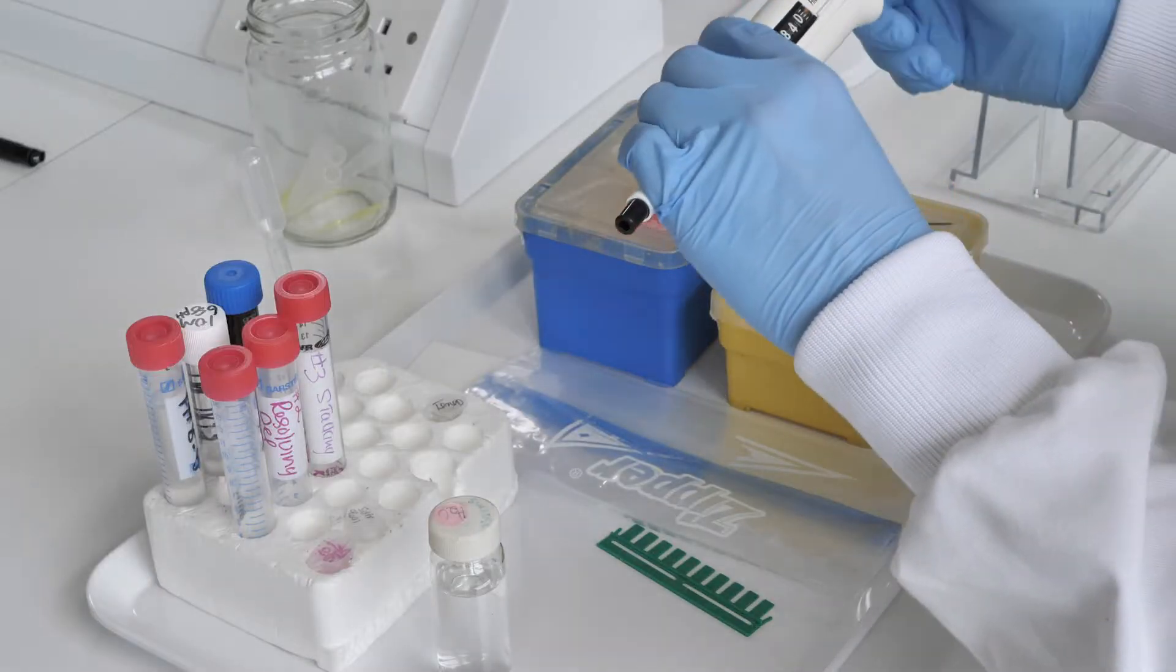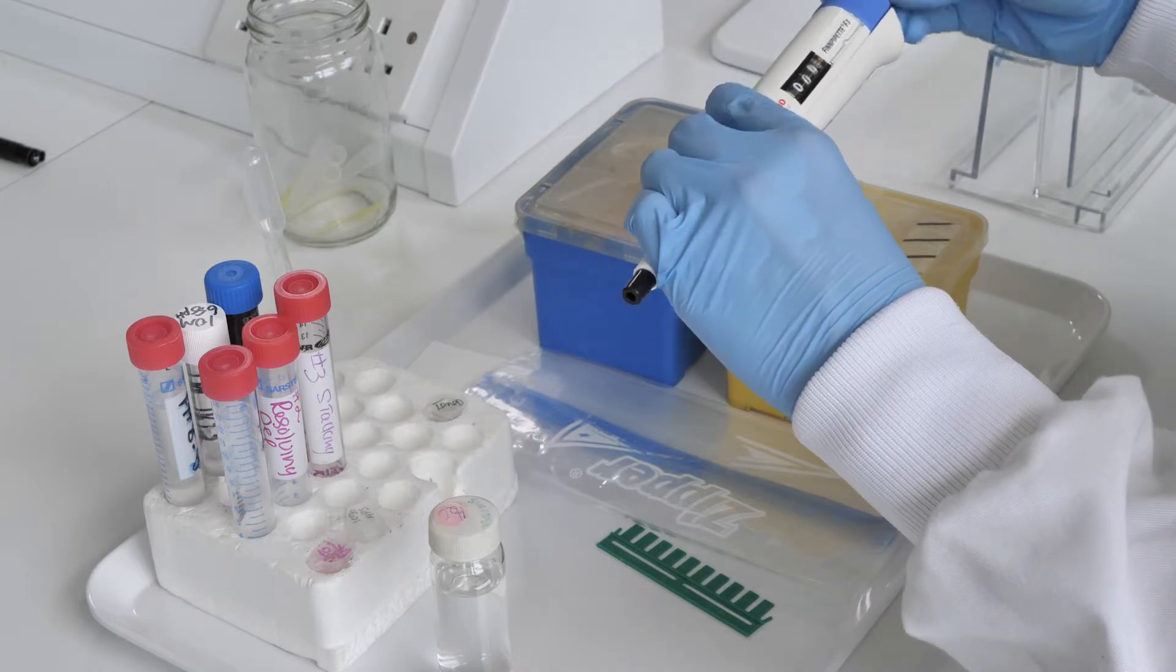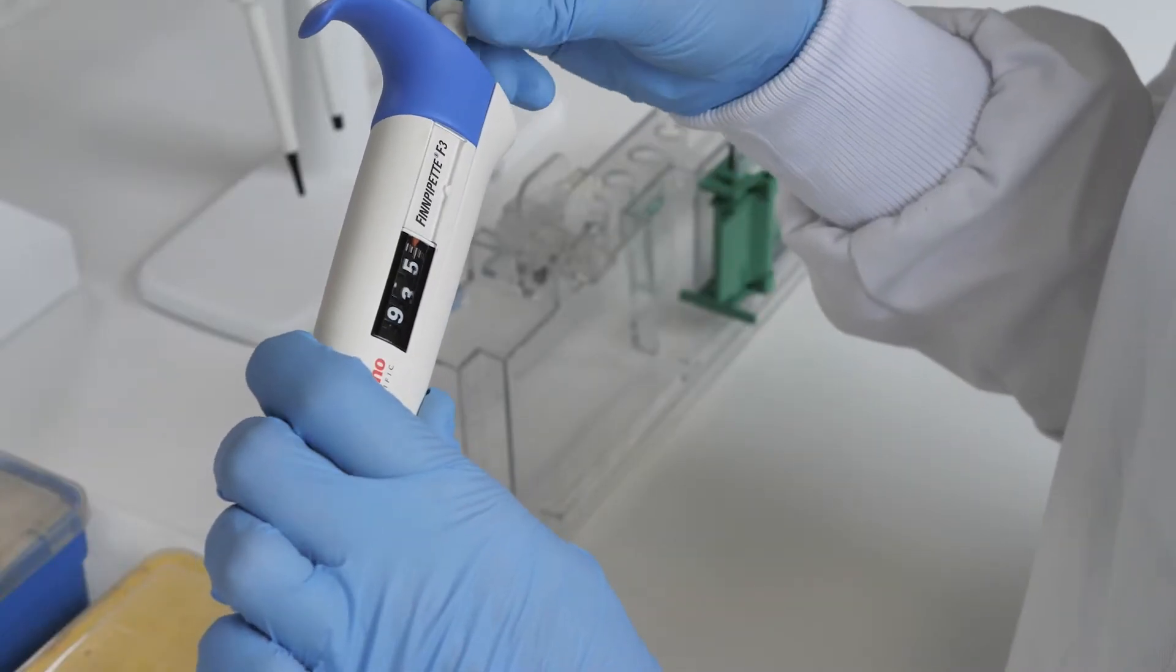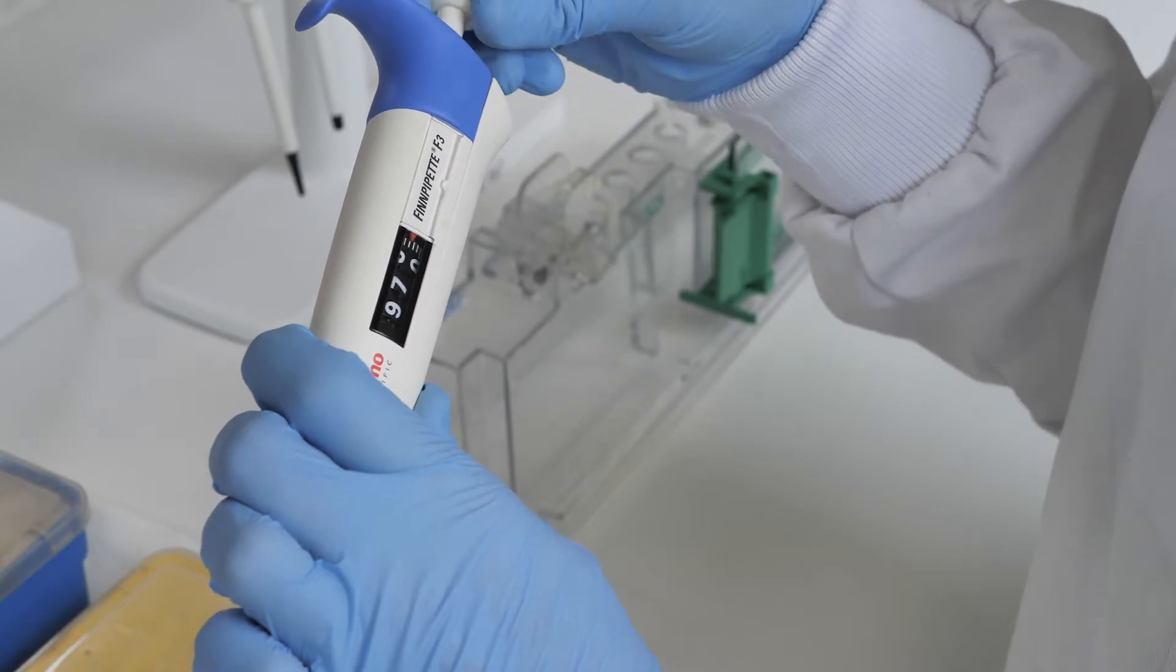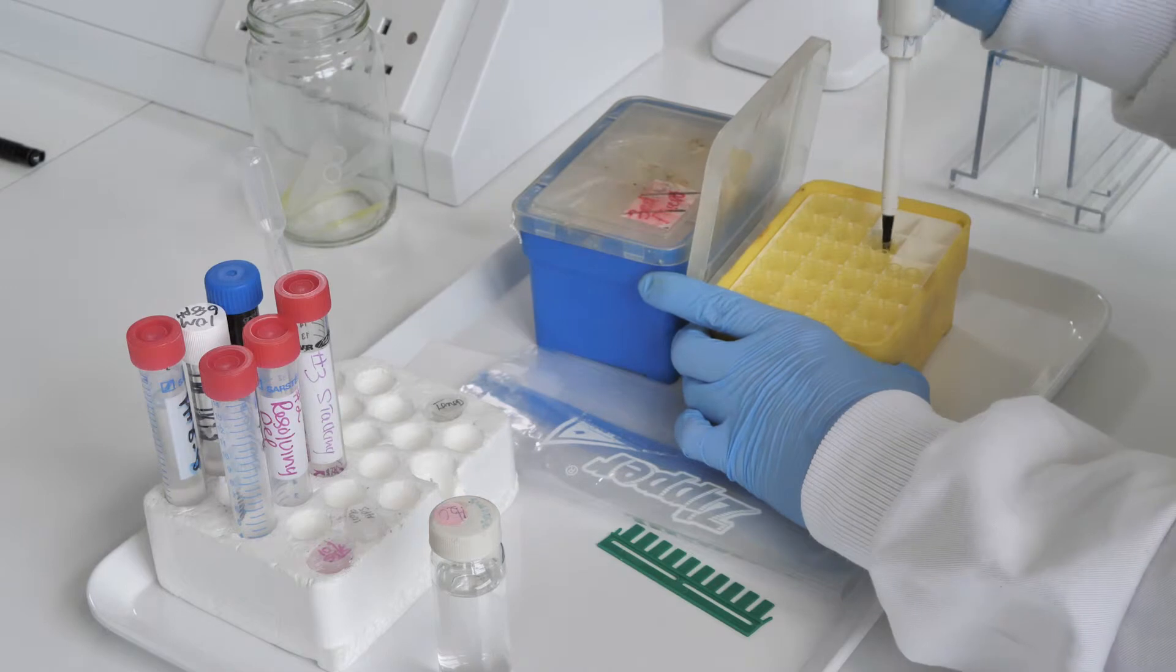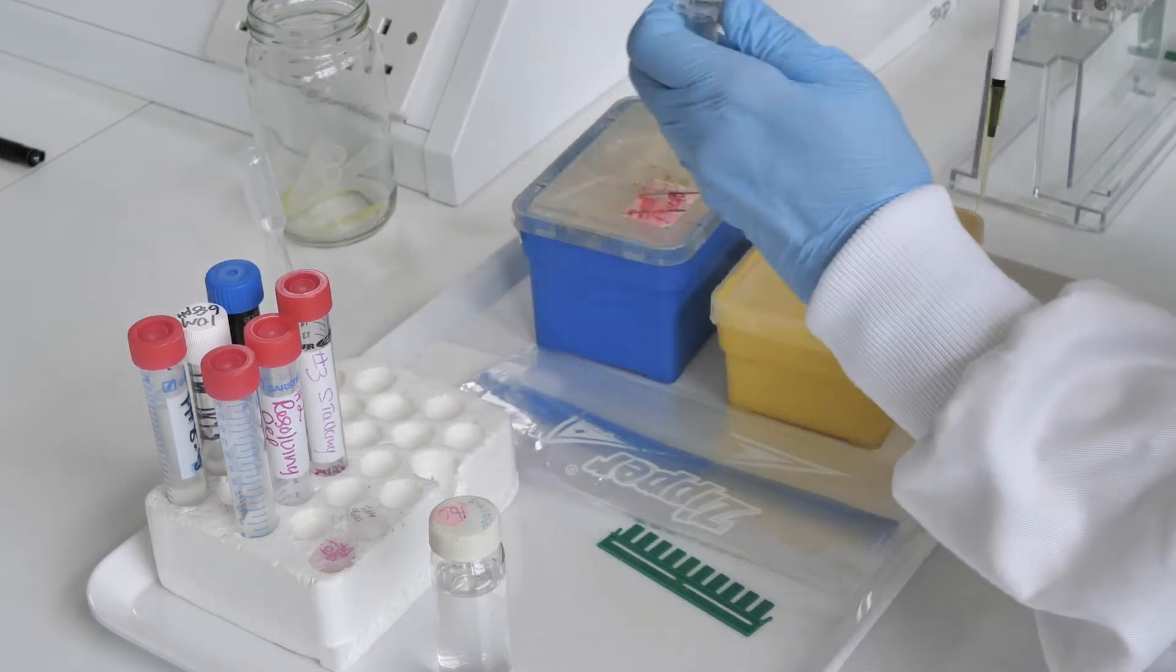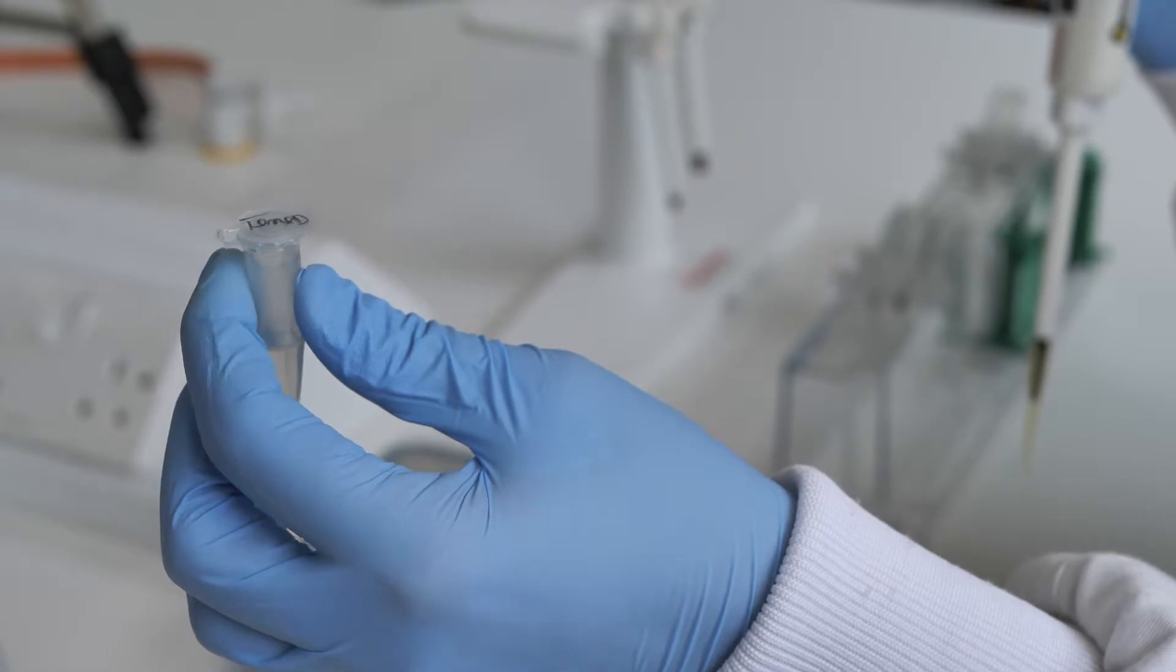Before you add the TEMED, also check that the largest pipette, the 1000 µL pipette, is set to maximum volume of 1000 µL. Ensure you add the TEMED last as this initiates polymerization reaction.